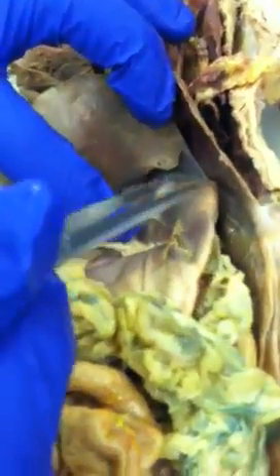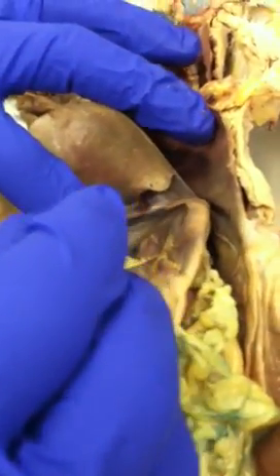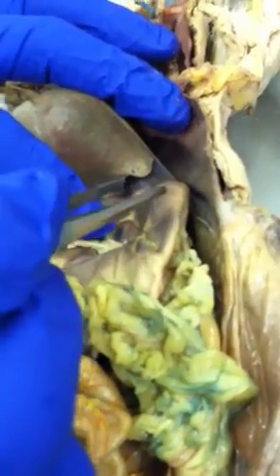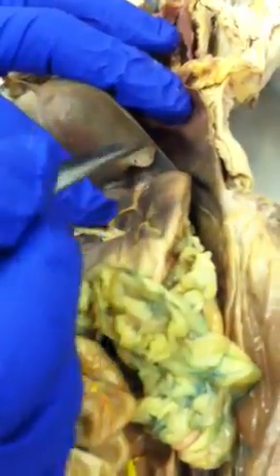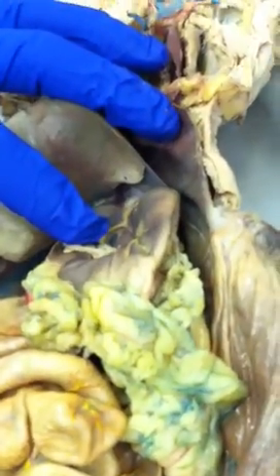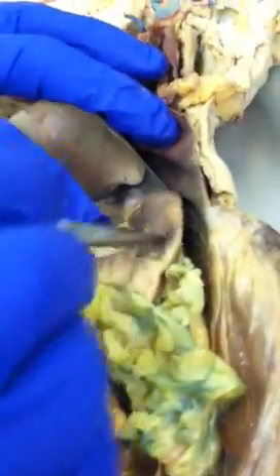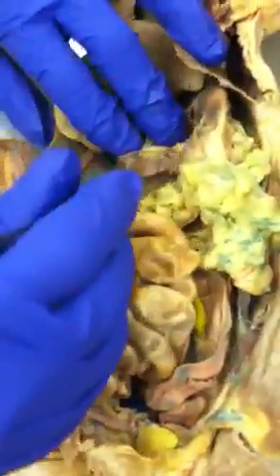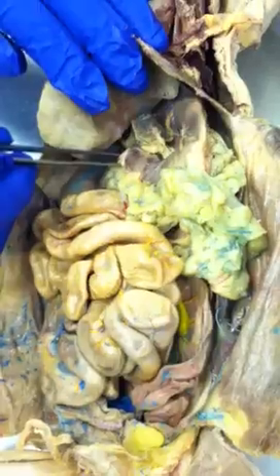So if I were to place a pin over here and say what part of this organ it is, because I won't say stomach, because then that's giving it to you. So this would be the fundus, and then the rest of it, the big part here, will be the body. All right, and then you keep going down. This will be the pyloric region. You see this sort of tapered part of the stomach down here, and then of course this will be the, you see it, pyloric sphincter, right? And then immediately after that we start the small intestine, right?